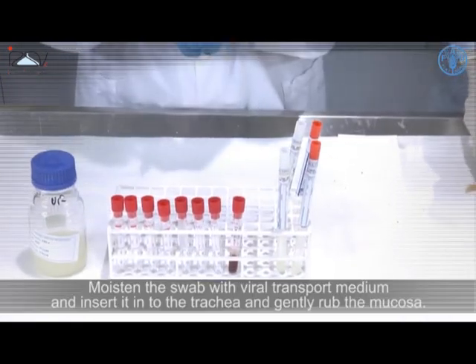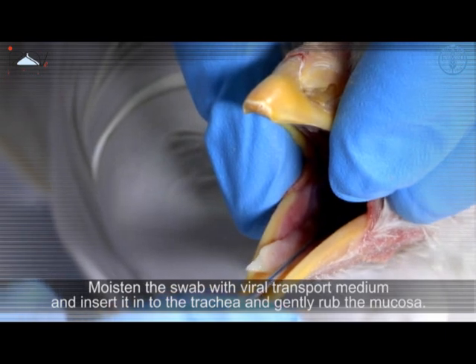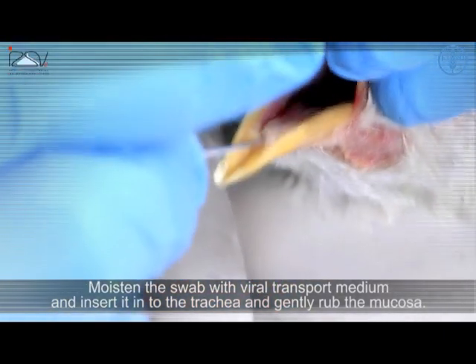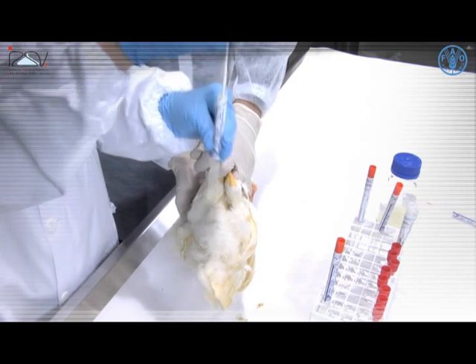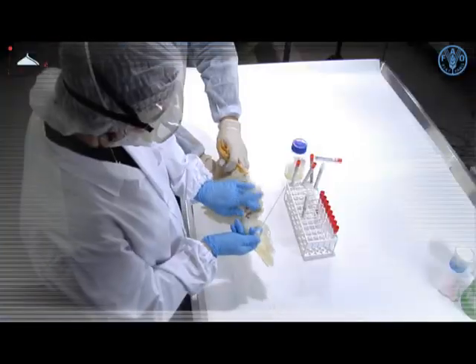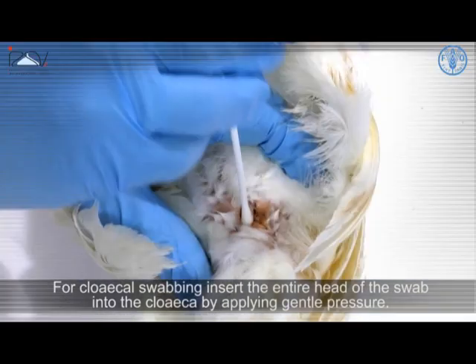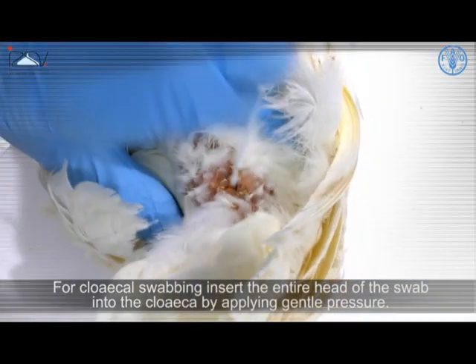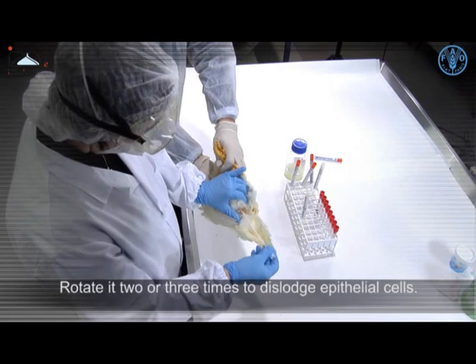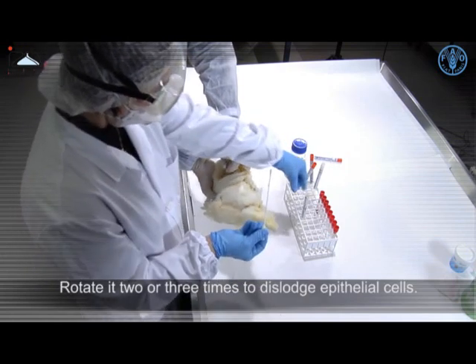Moisten the swab with viral transport medium and insert it into the trachea and gently rub the mucosa. For cloacal swabbing, insert the entire head of the swab into the cloaca by applying gentle pressure. Rotate it two or three times to dislodge epithelial cells.